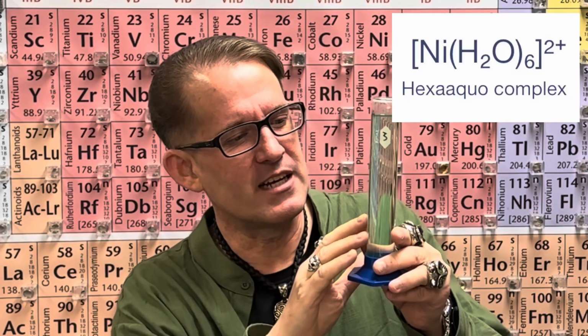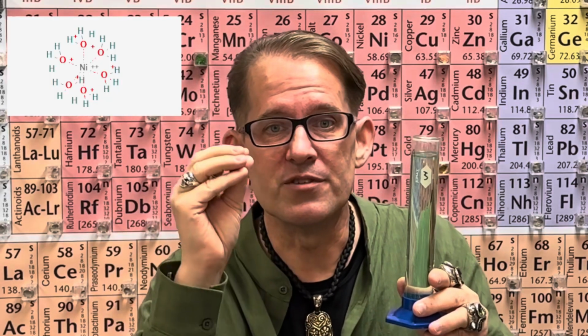And what's a ligand? A ligand is any molecule that bonds typically to a metal ion. So in this hexahydrate form, where it's this light color, we have 6 water molecules that are bonded to the nickel ion. But when I add the ammonium hydroxide, you have a ligand exchange, and those 6 water molecules are replaced by 6 ammonia molecules, and that's what creates that deep blue purple color.